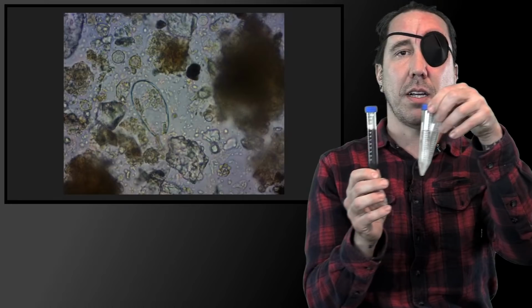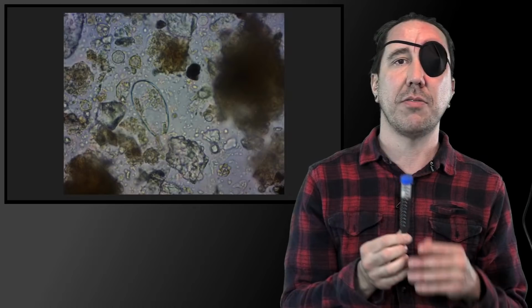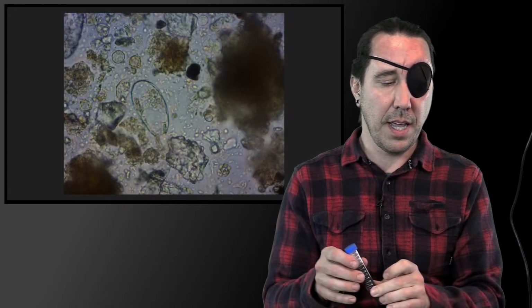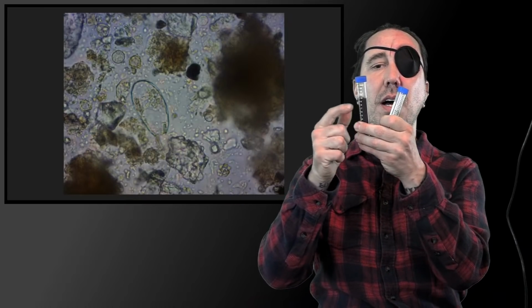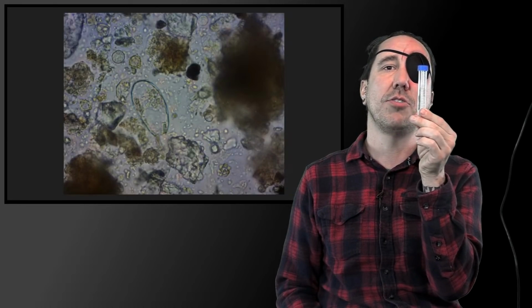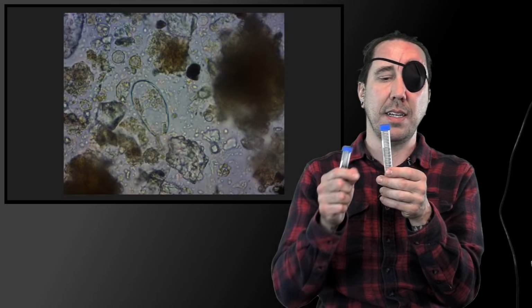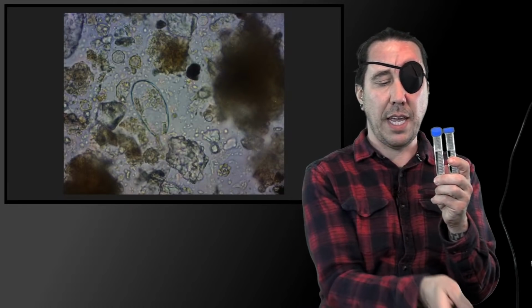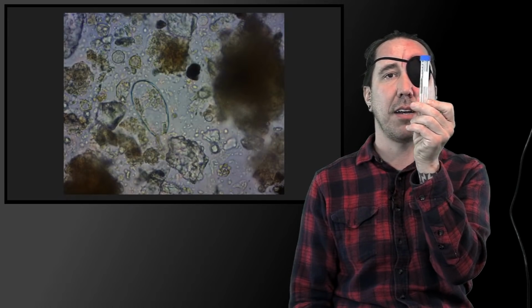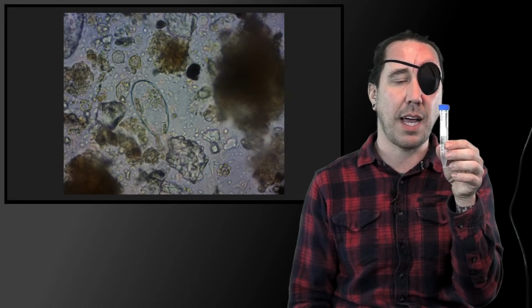So we're going to do what's called making dilutions. This is a 1 to 10 dilution. I do most counts for all protozoa, fungi, and nematodes at a 1 to 10 dilution. Then I'll take 1 milliliter of this and add it to the 9 milliliters of this. That makes a 1 to 100 dilution. For counting bacteria, that's generally not enough. You still usually have a whole lot of bacteria, so it's a lot easier to dilute down even more. I will take the 1 to 100 dilution and add 1 milliliter of that into this 9 milliliters, and that makes a 1 to 1,000 dilution. So I'm generally doing bacterial counts at a 1 to 1,000 dilution.